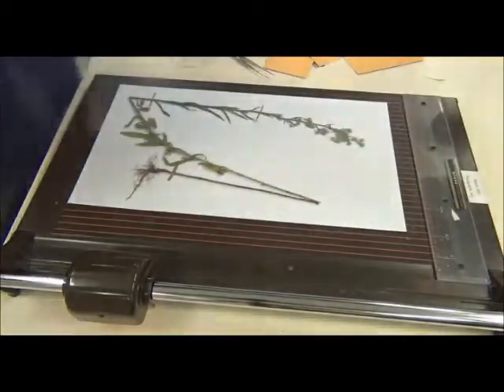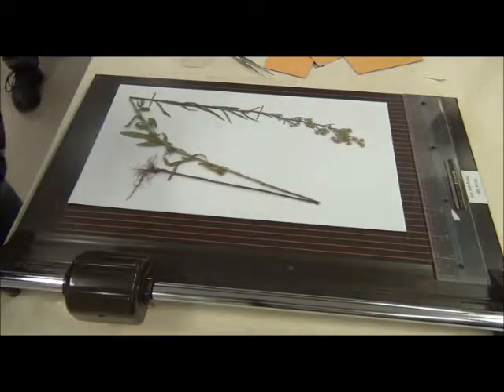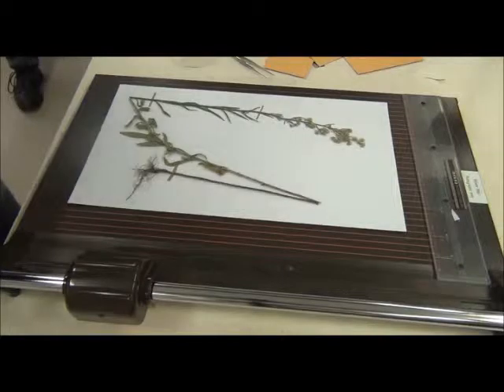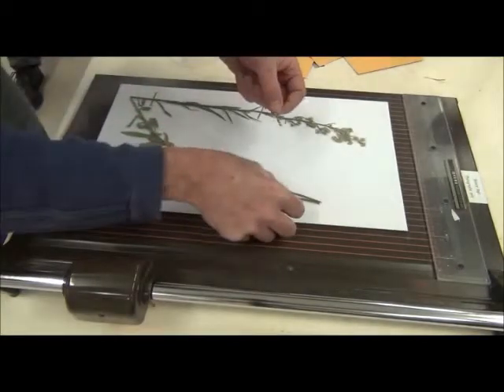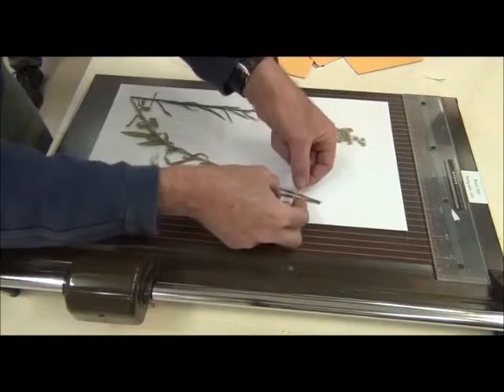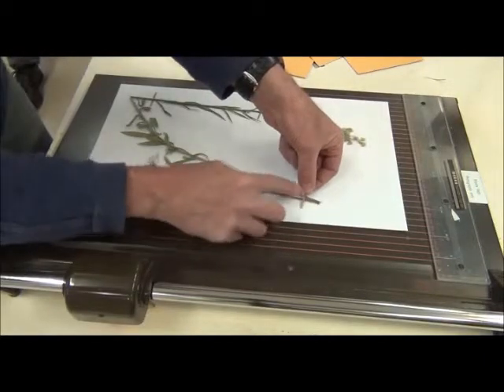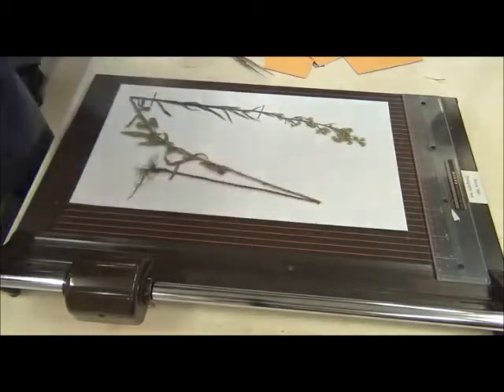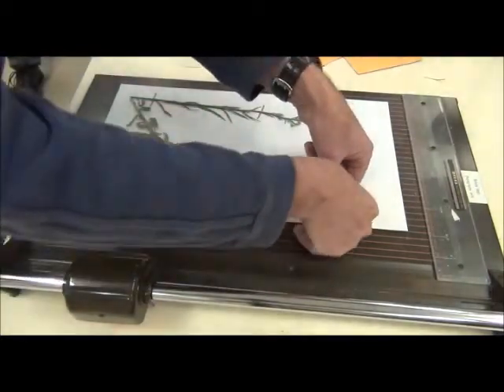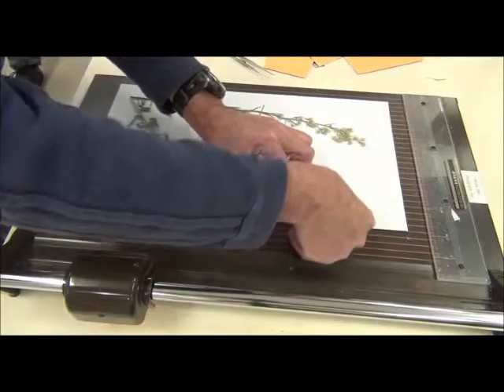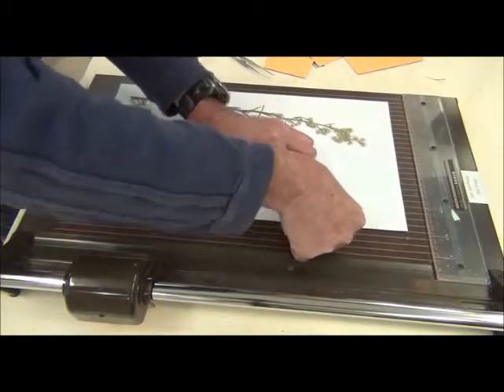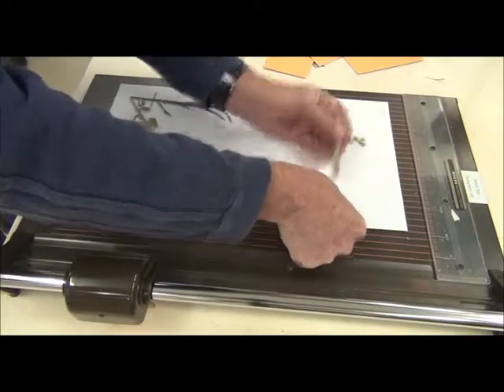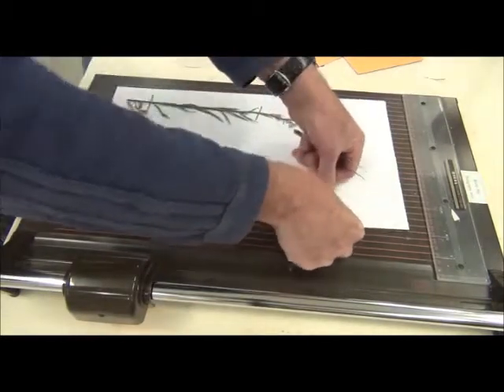Now, whether you put one there as well or not, I think is sort of marginal. I'll do it just to give you an idea of more... Of another thing. If I... I can... What I won't do is just do it across the top and create that tent. If I did go over both of those, I would go down and under. Alternatively, I can go right up the top where it's effectively acting as one piece.